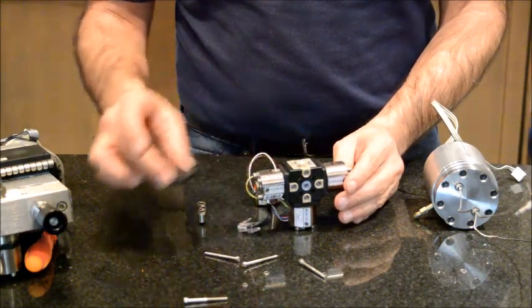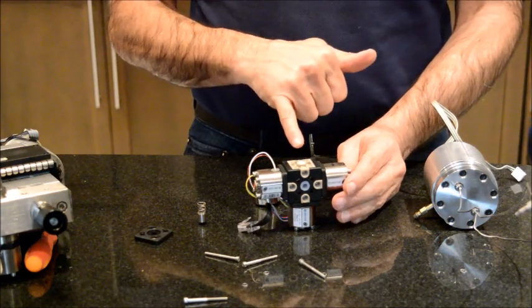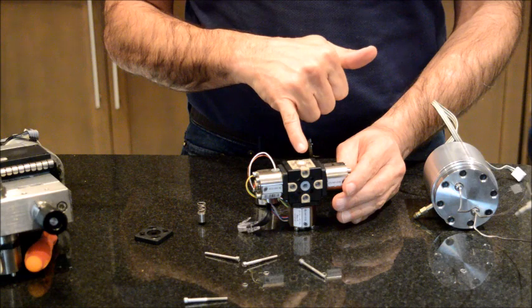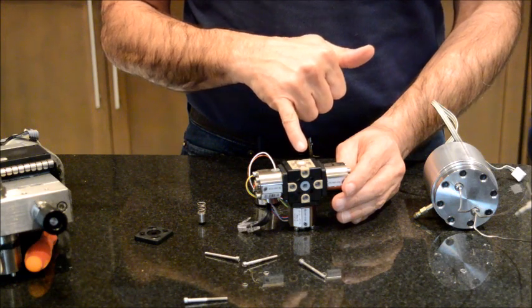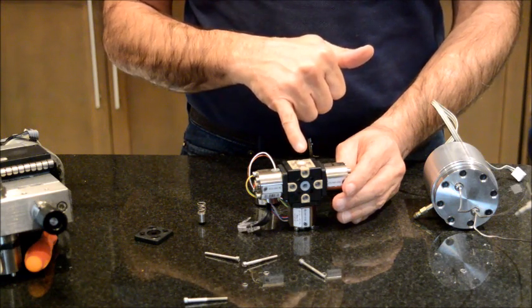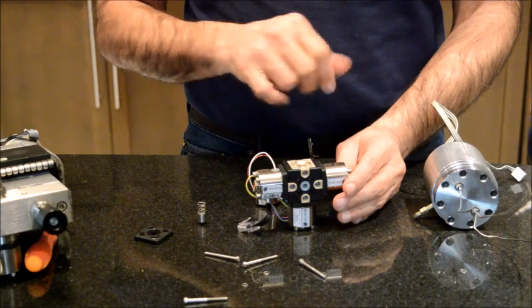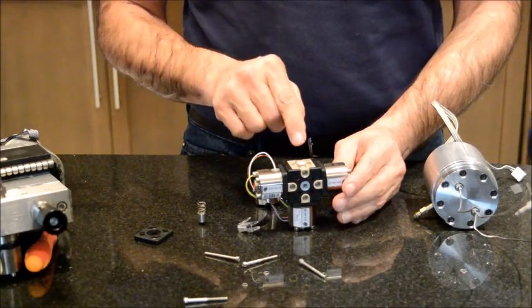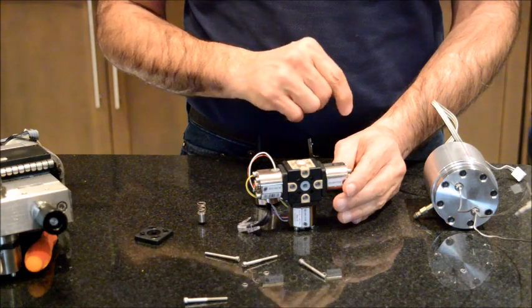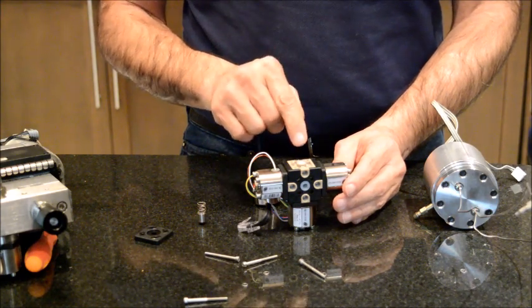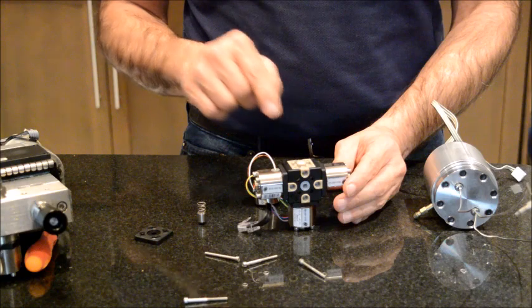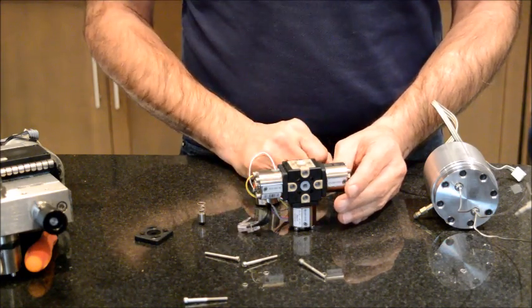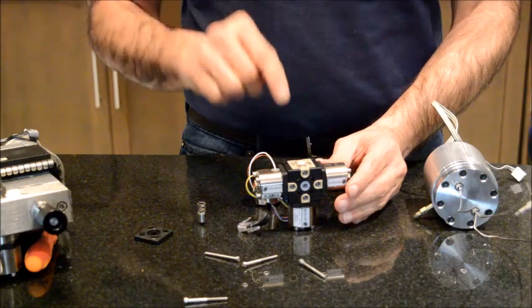There is a black piece, remove that. And there is a very tiny—there's three pieces: there is a sapphire sphere, there is a cone-shaped piece on top of the sapphire, and there is a membrane. Most likely these three parts, these pieces, are consumable, and by replacing these and putting a new one, you will regenerate your line B. Let me go back to my computer and I will show you the close-up of these parts before I continue.